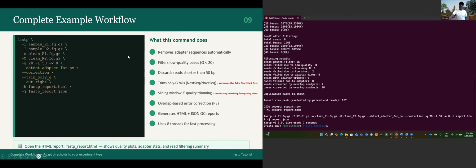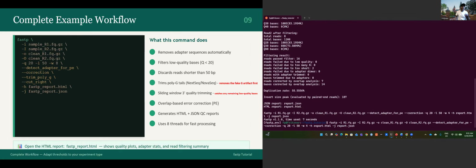So this is a complete example. Before we move forward, it's almost the same. Let me just come back to the same script that we have. What changed is that you just have the trimming poly G and the cut right. This is just what has been added in this FASTP analysis. Yeah, I think you can add it here. I just add --trim_poly_g, and --cut_right.